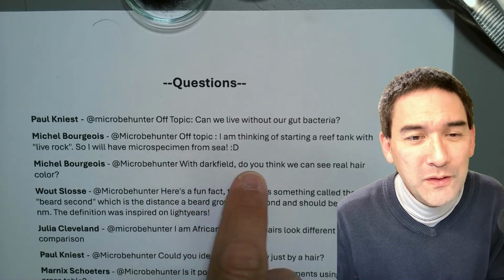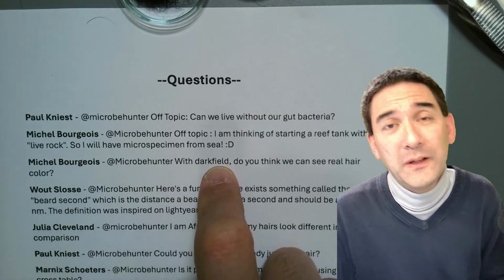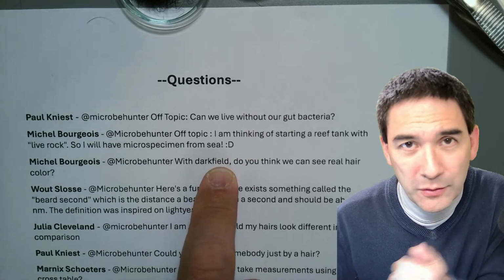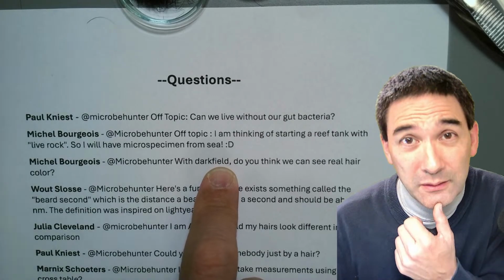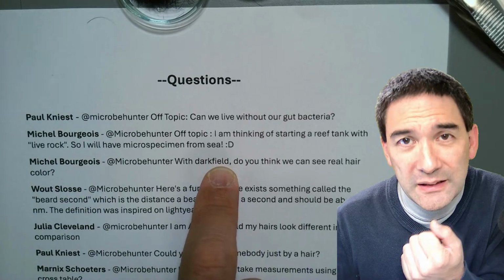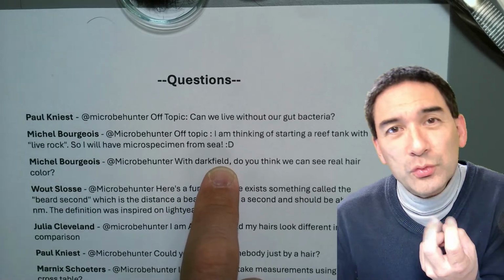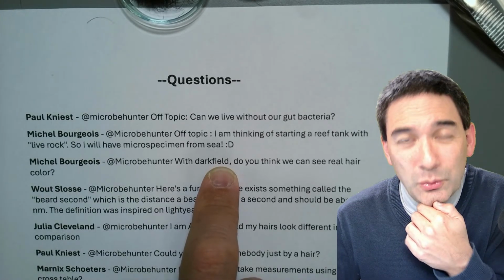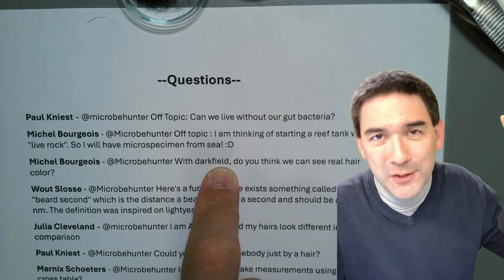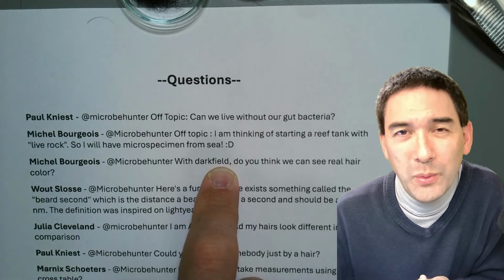Yeah. With dark field, do you think we can see a real hair color? I think I just talked about that. The thing is the following: it's somewhat a philosophical question. Any kind of technique in the microscope, dark field, DIC, polarization, even bright field, because with bright field you can also adjust the contrast and so on. Any type of technique with a microscope changes the colors somehow. So the question is what is now real, right? If you want me to go philosophical, what is my real hair color? Well, it's black. Well, actually, no. It depends a little bit how the light shines on it and the brightness of the environment and so on. So even, yeah, it's a philosophical question. What is real, right?